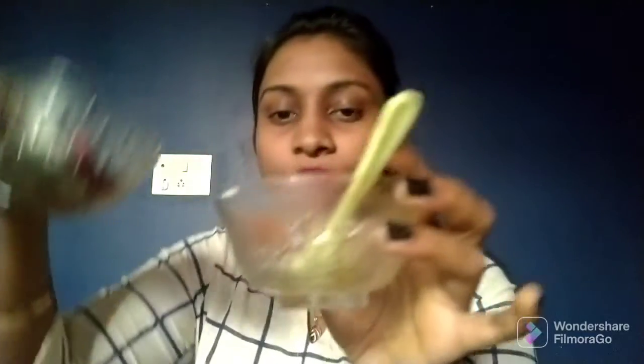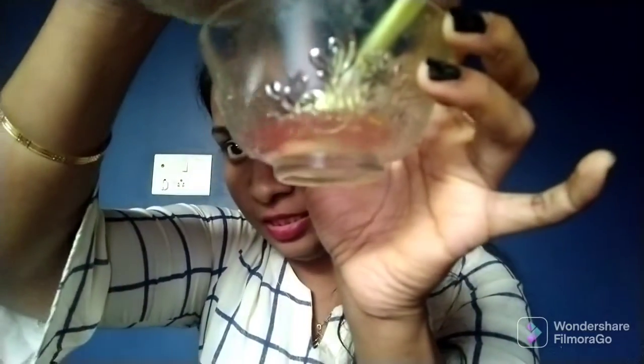This drinking soda, I am adding this to this empty beaker. Now I will add the China rose water. What should be the color of this? It should be the pinkish color. You can see here, it is pink color. So this is also an acid.